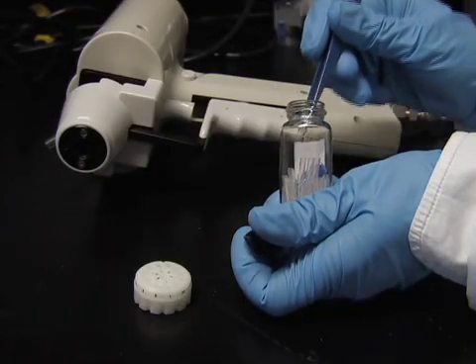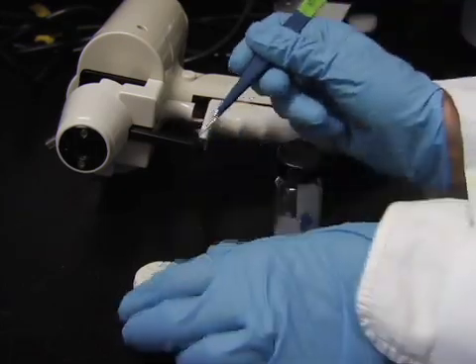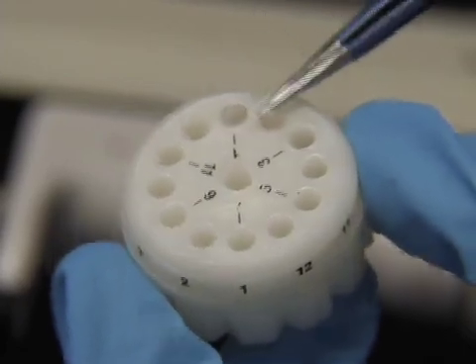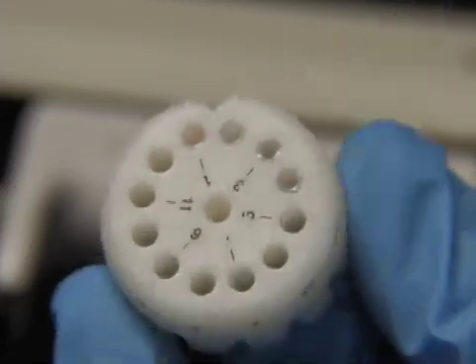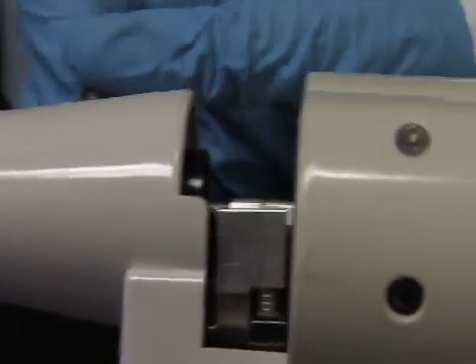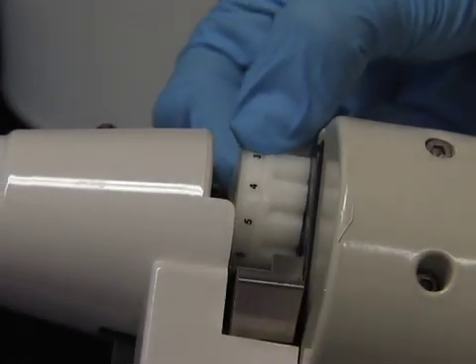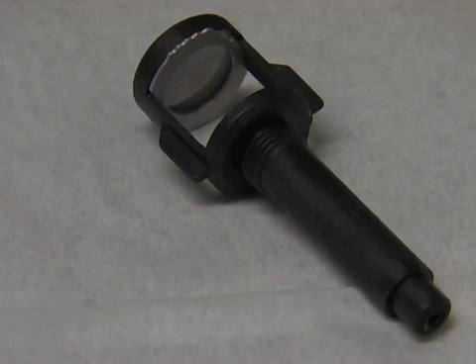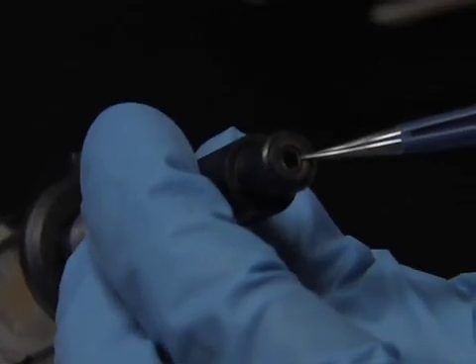Once the cartridges have warmed to room temperature, open the scintillation vial and place the gold coated plastic cartridges into the cartridge holder. Then place the cartridge holder into the gene gun by first pushing back the cylinder lock.